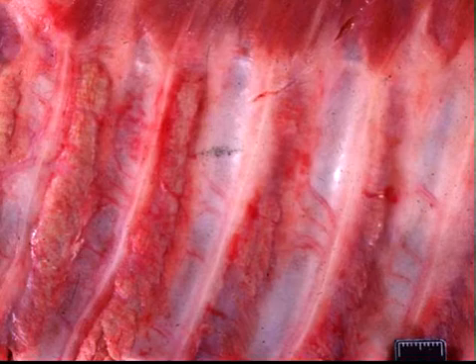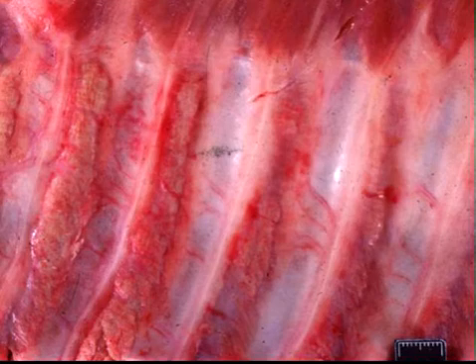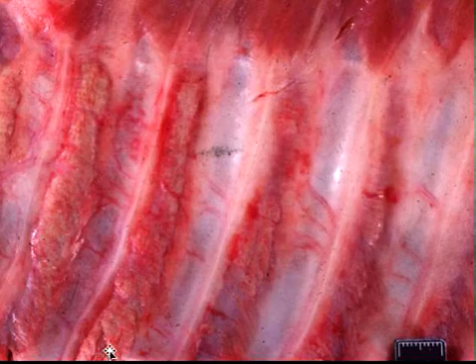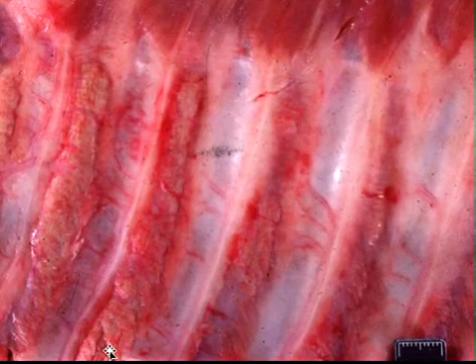Question 8 is a dog, and I would like a morphologic diagnosis and a cause. Okay, morphologic diagnosis, we are looking at the ribs from the inside, and this is multifocal subpleural mineralization. It's just under the pleura, and the superficial part of the muscle is mineralized. And the cause, you could have gone one of two ways with this.